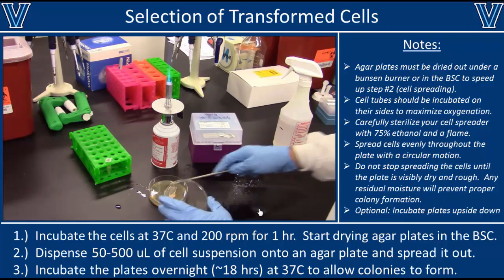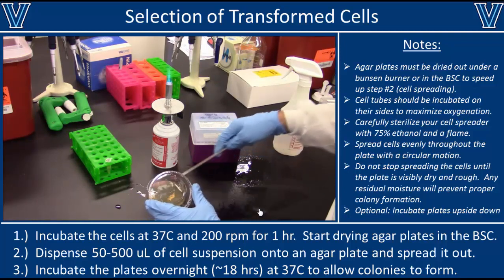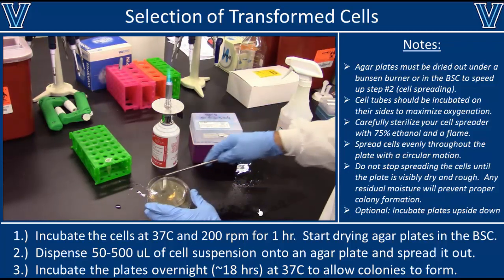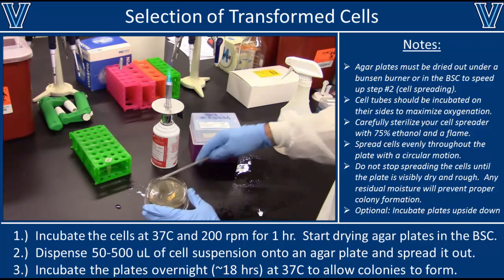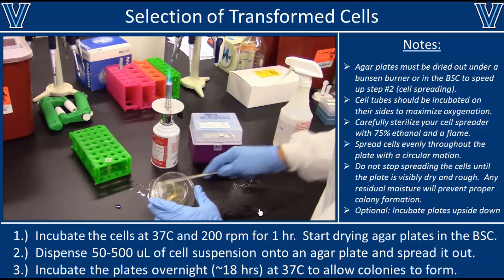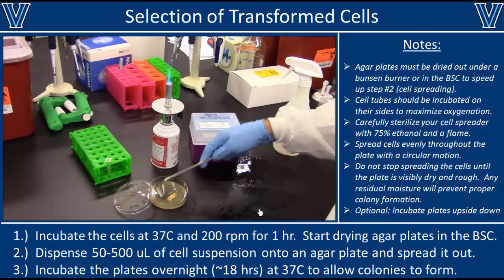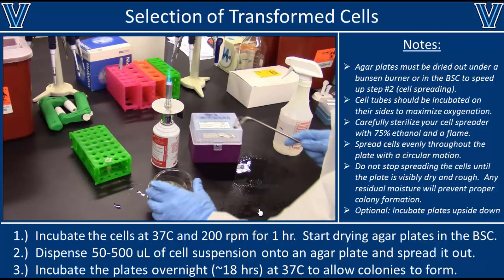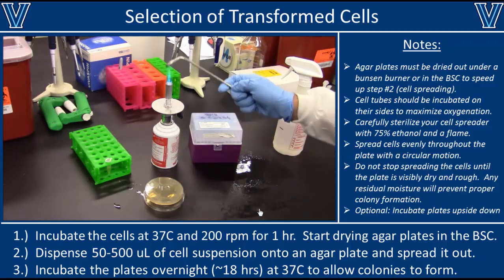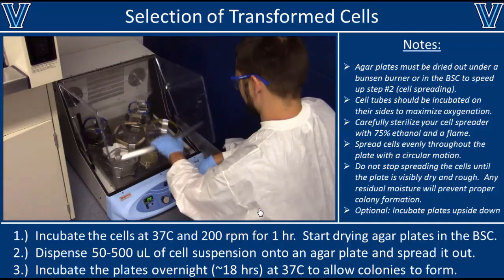The final test is to touch the spreader to the agar — if it melts the agar it's too hot, but if the agar remains solid then you're ready to go. Spread the cells by moving the cell spreader in a circular motion for about one minute, until you feel a dryness on the plate and it starts to feel rougher. It is very important to spread until the plate is dry — if any liquid remains, the cells will not form colonies but instead form a snotty mass that covers the entire plate. Once done, sterilize the cell spreader again, then incubate the plate at 37°C overnight without shaking.